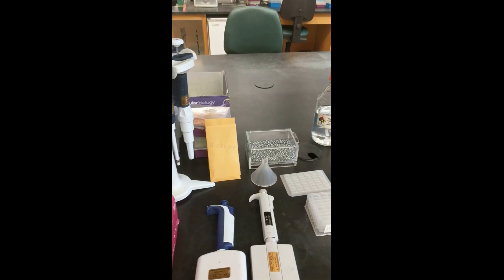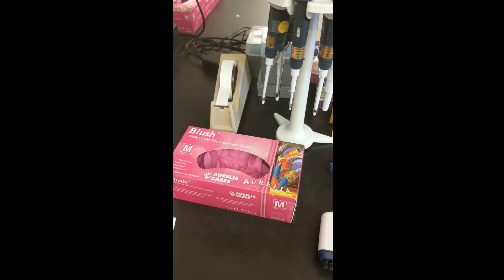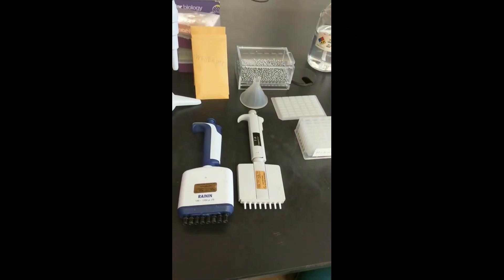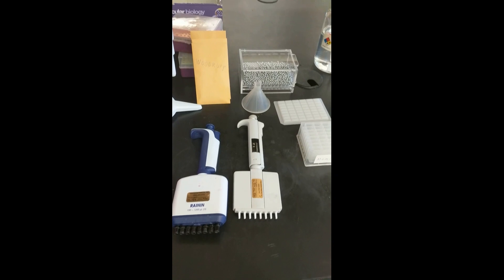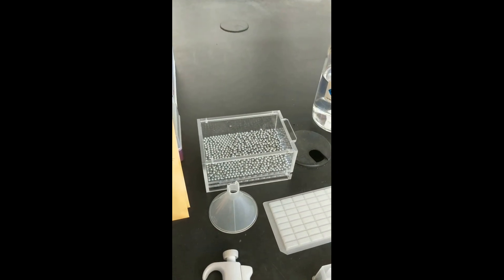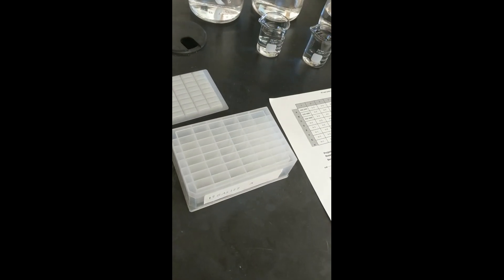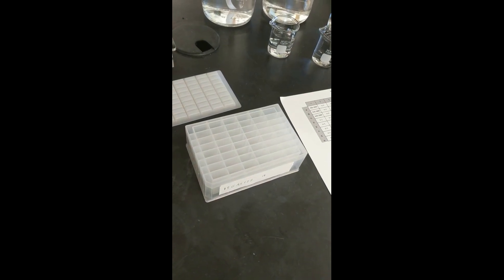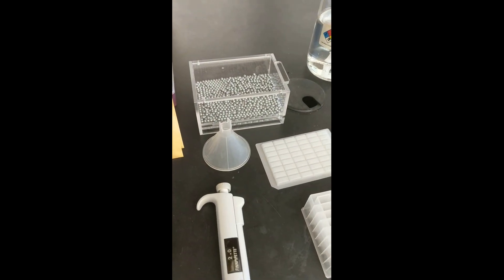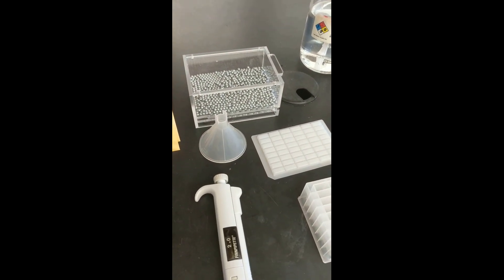For this process, we will need sterile lab gloves, various pipettes of both the single-channel and multi-channel variety, the seeds we wish to extract DNA from, BBs, a 48-well plate to hold our seeds, and a funnel to place the seeds into the plate.